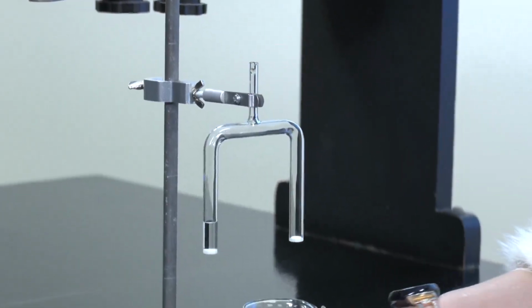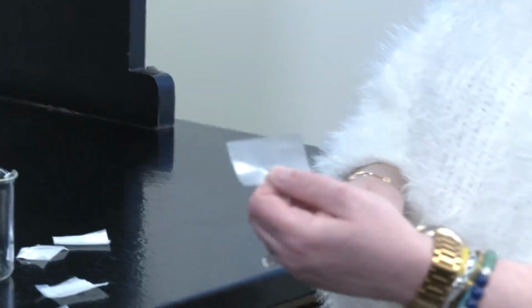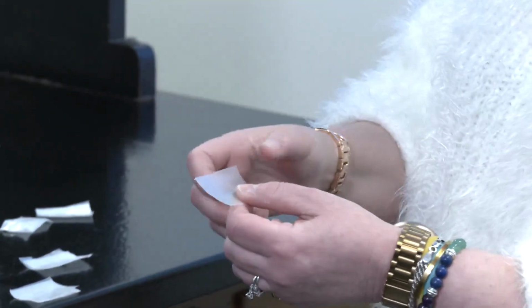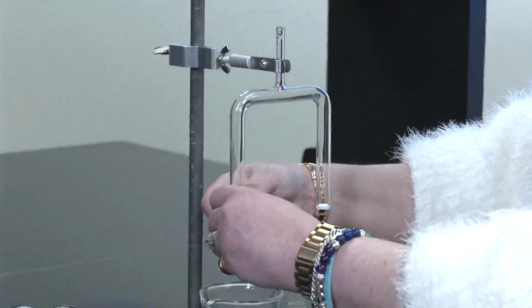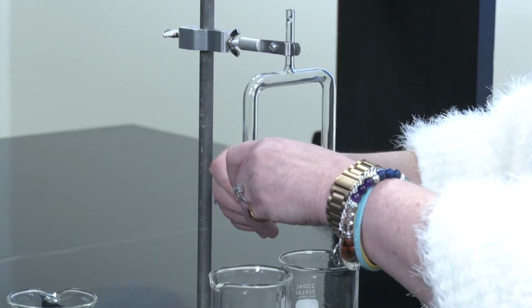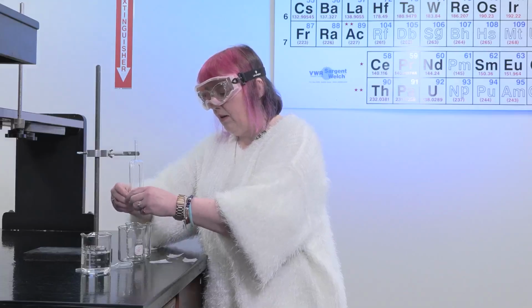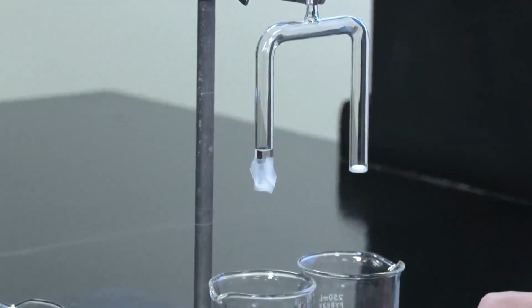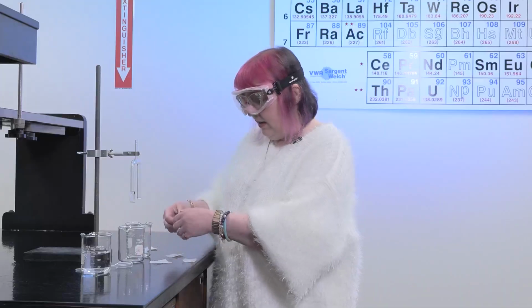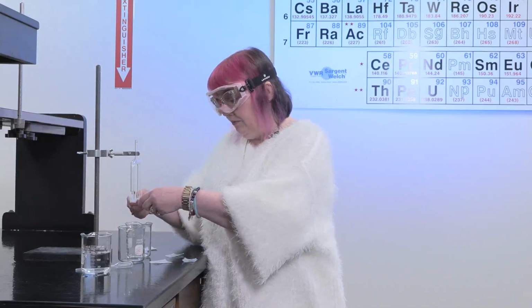The first thing we're going to do is take some parafilm. So you'll cut some small pieces of parafilm, and then you're going to take this parafilm and put it over the bottom of each of these. So we want to make sure that we've covered this so that it can't get out. And it's somewhat complicated to get it on there. We need 1 piece for each side. I have some extra pieces over here just because it usually screws up.